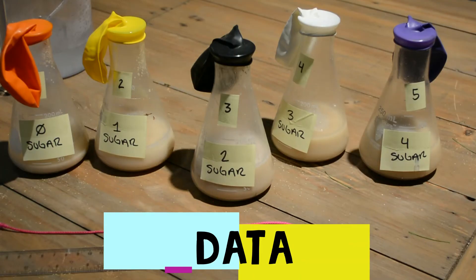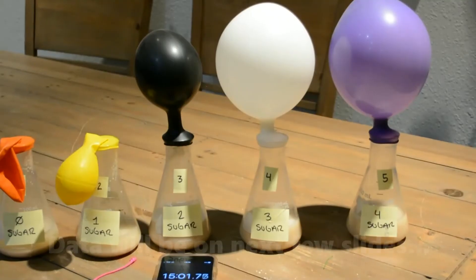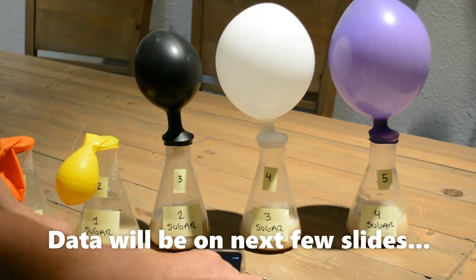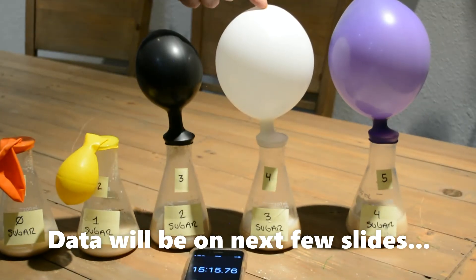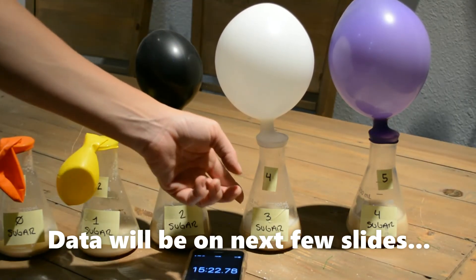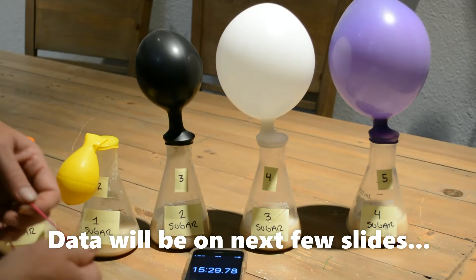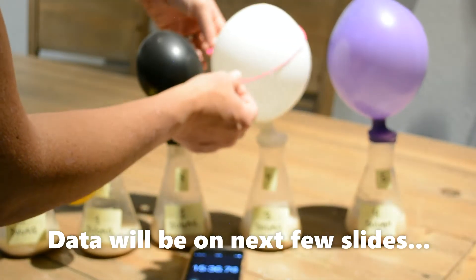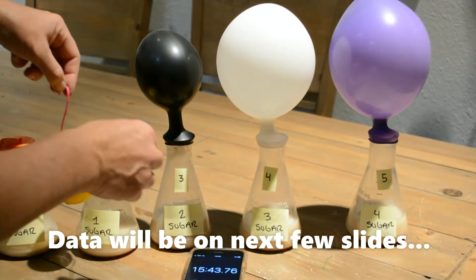Let's skip forward to 15 minutes. You can see by now that the yeast is breaking down the sugar and capturing CO2 inside the balloon. If you were to smell inside the balloon it actually smells like alcohol — almost like a sourdough bread smell. We're going to take our string, wrap it around the circumference as best we can, and then measure and record the data.